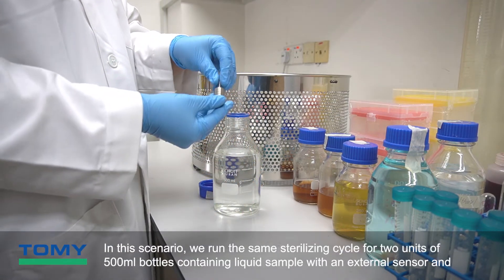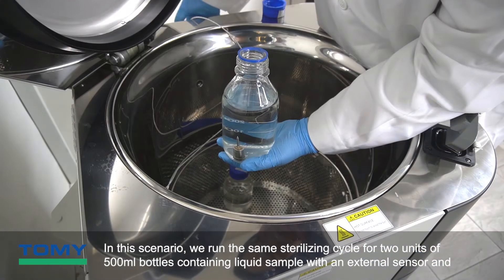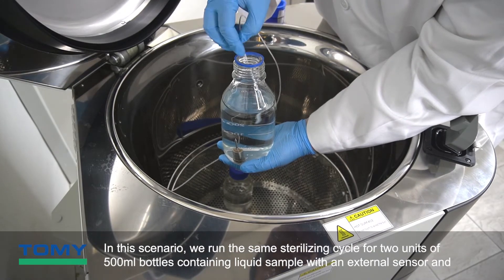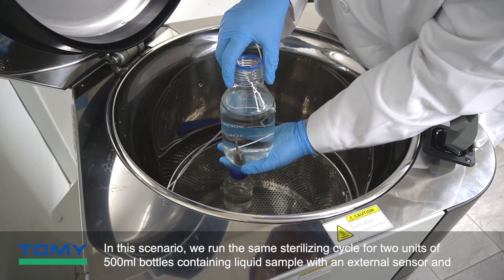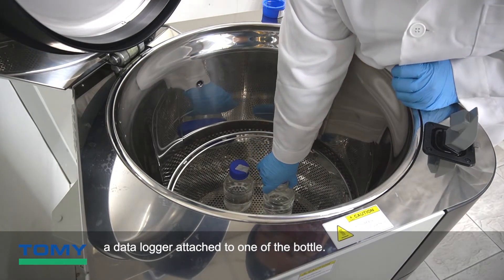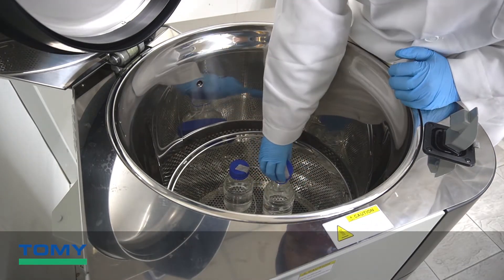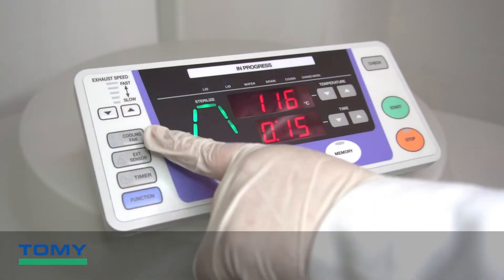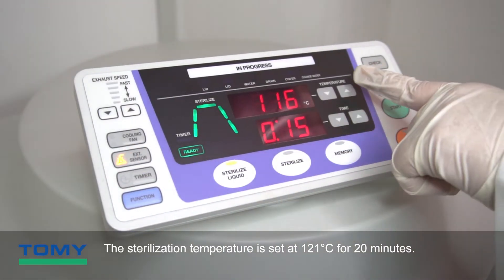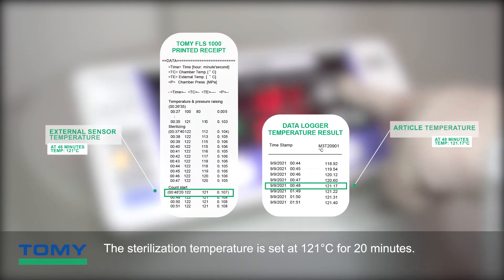In this scenario, we run the same sterilization cycle for two units of 500 milliliter bottles containing a liquid sample, with an external sensor and a data logger attached to one of the bottles. The sterilization temperature is set at 121 degrees Celsius for 20 minutes.